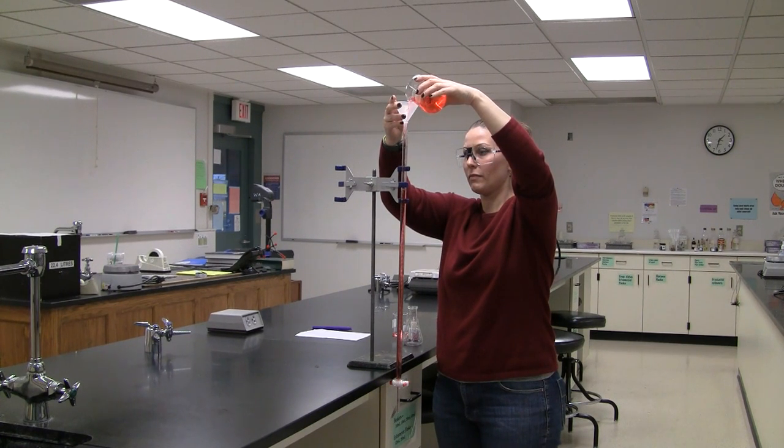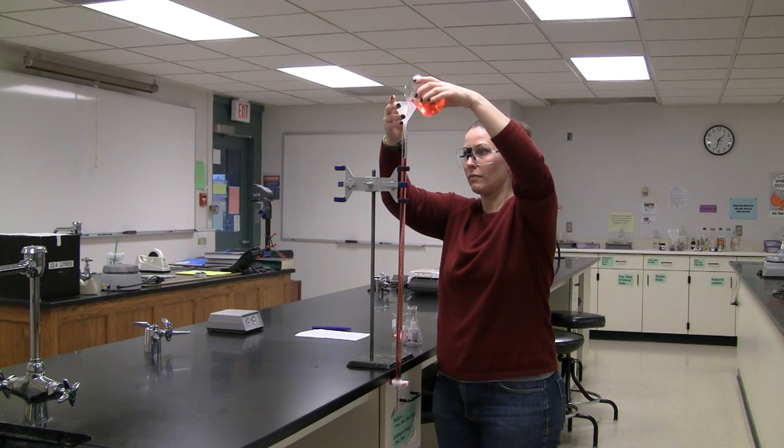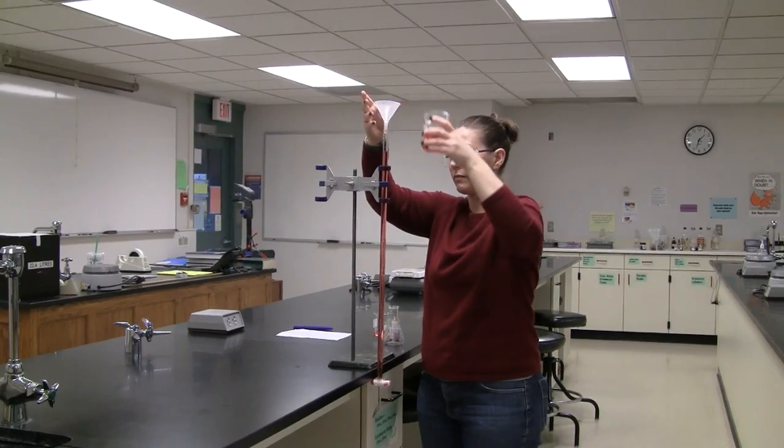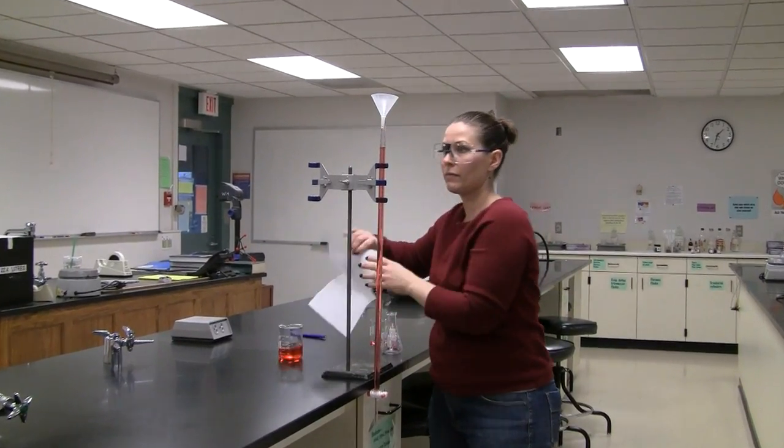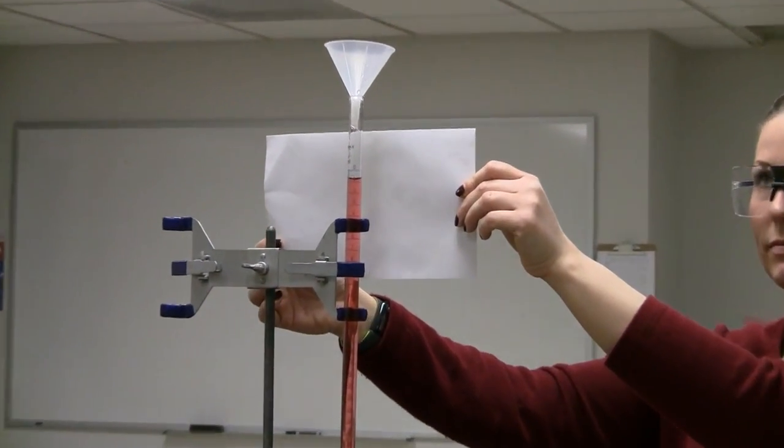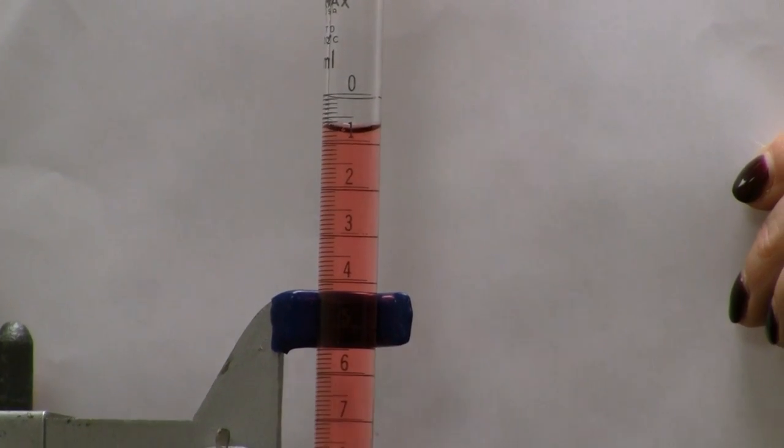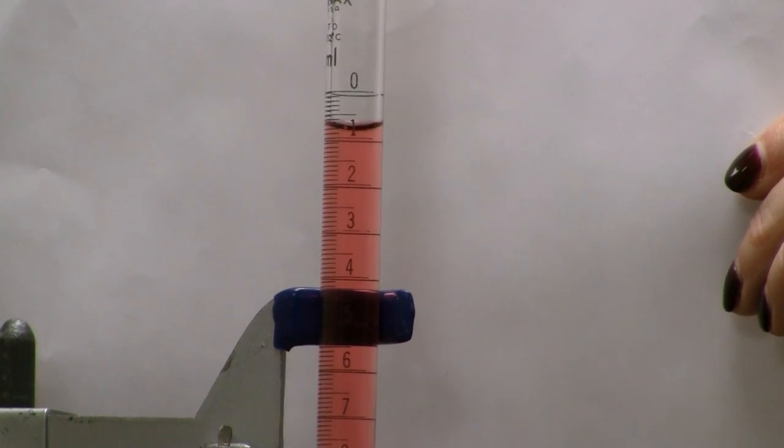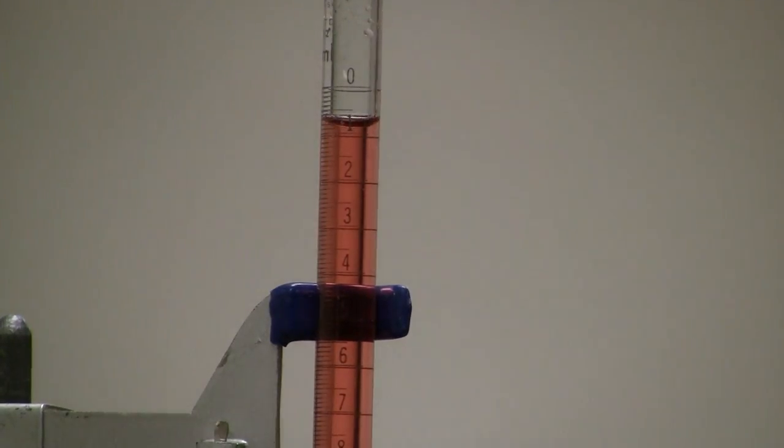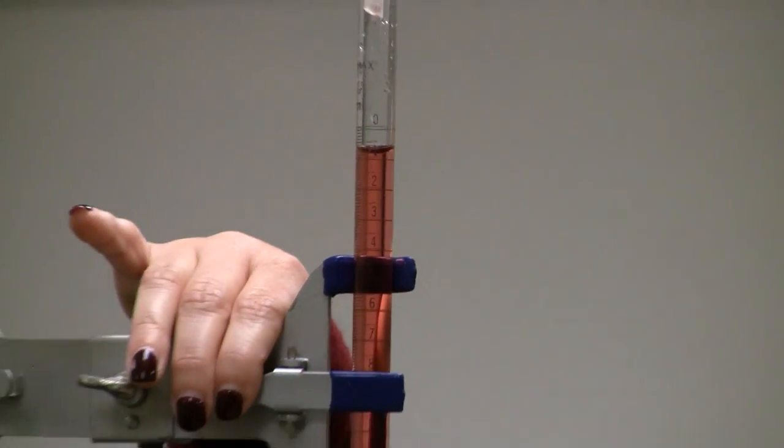Take the time now to record your initial volume to the hundredths place. Move the burette back into position for the experiment.